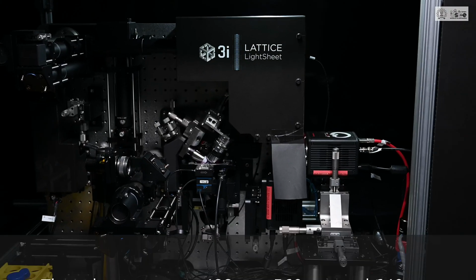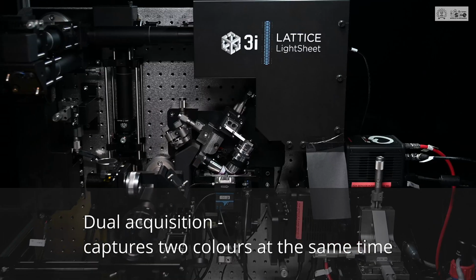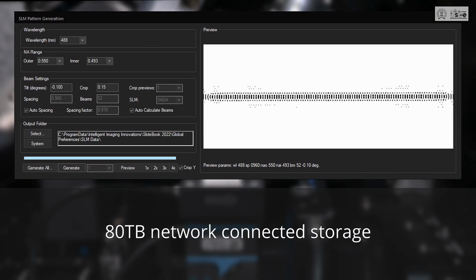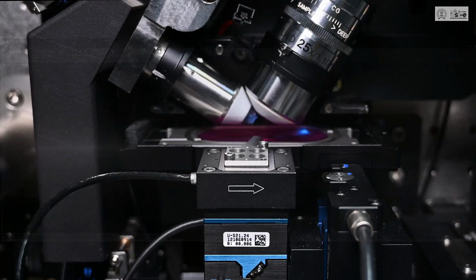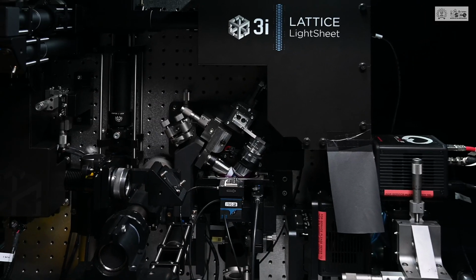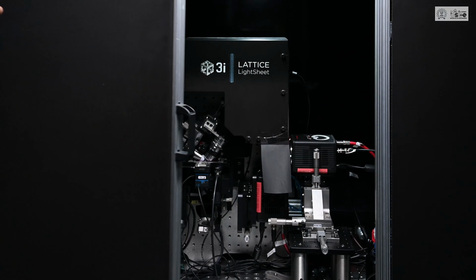The 3i lattice light sheet is a state-of-the-art machine that can give high-resolution images at a high speed without bleaching or degrading the samples. It can capture 200 planes per second, and one can image samples for days and weeks continuously without any degradation. A spatial light modulator shapes the laser beam to create a light pattern. The illumination and detection objectives are designed to give better contrast. Equipped with a temperature and carbon dioxide control chamber, it is suitable to image live cells.